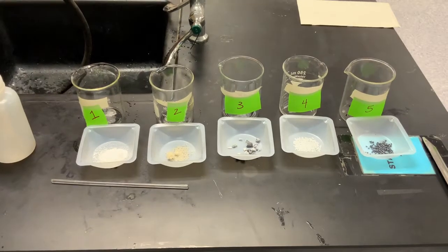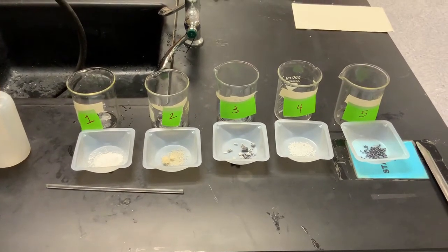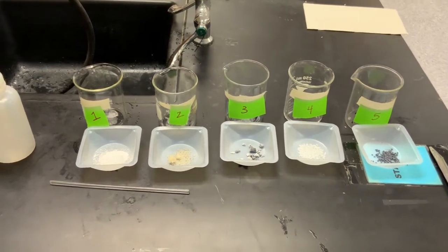This is part two of the What's in the Bottle Lab. We're starting off with looking at the general appearance of our five unknowns.